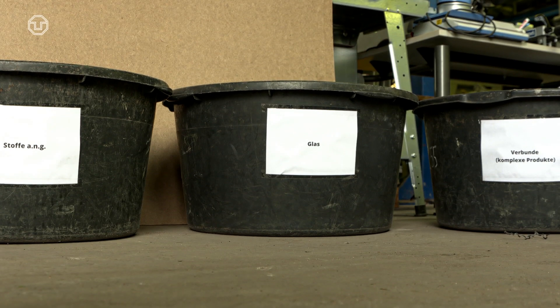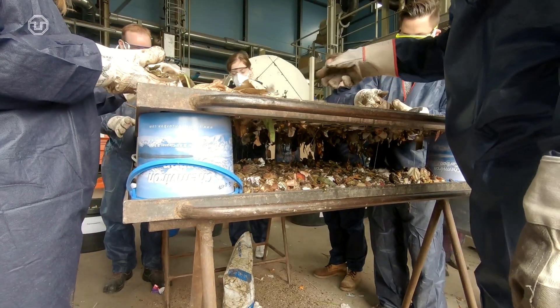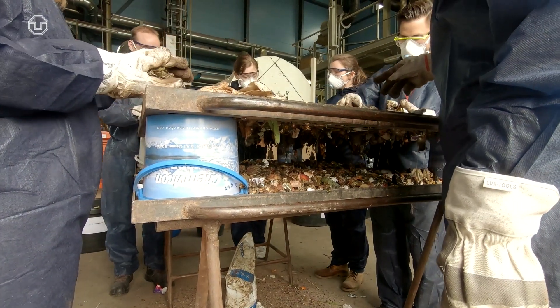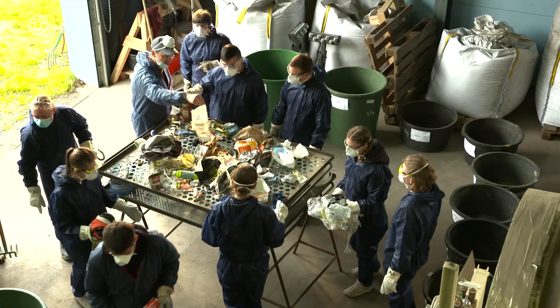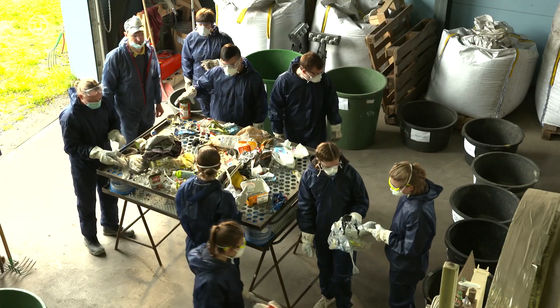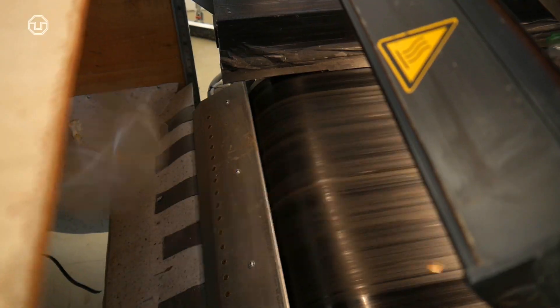Residual waste is composed of different fractions. To determine these, waste has to be sorted. A manual sorting is more precise than mechanical separation and hence preferable.